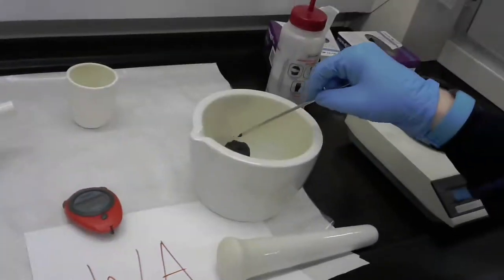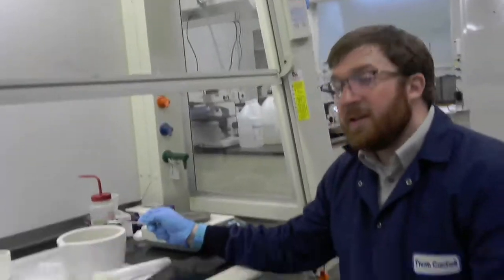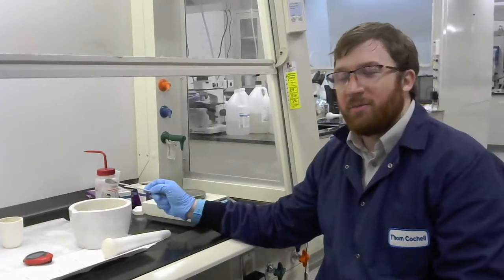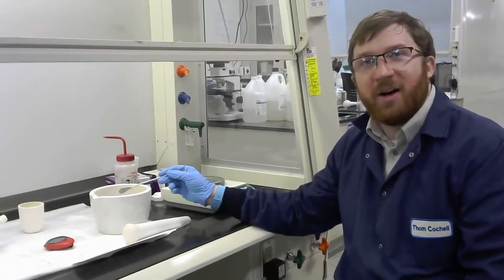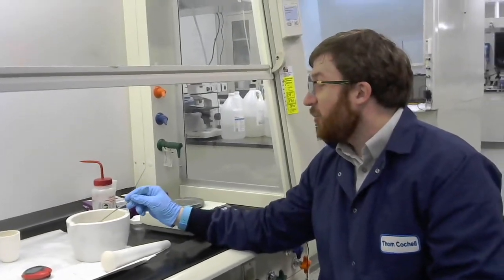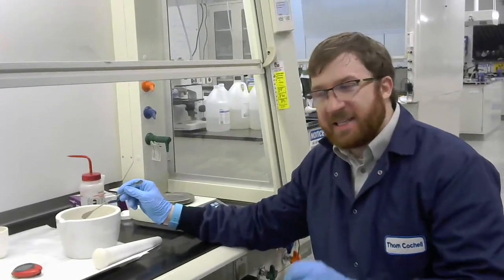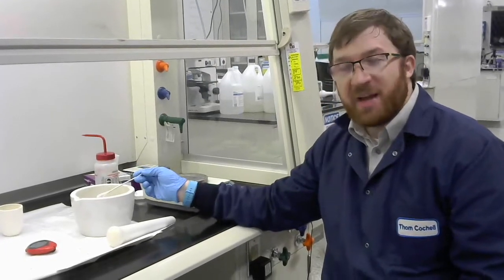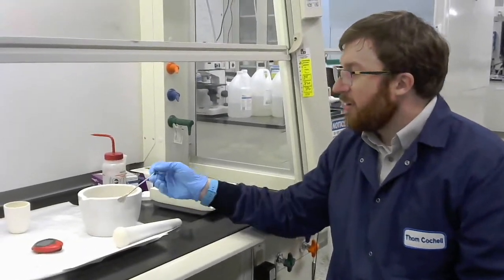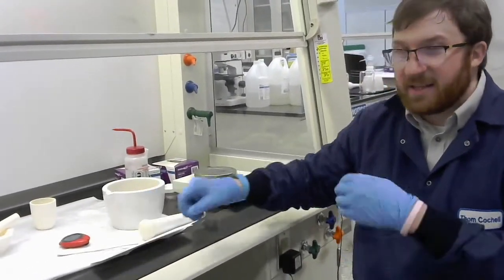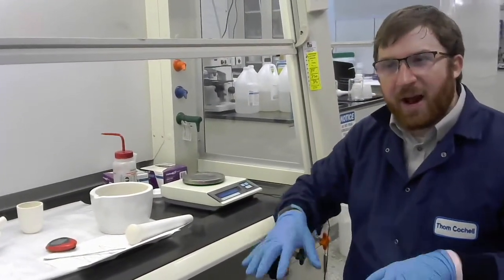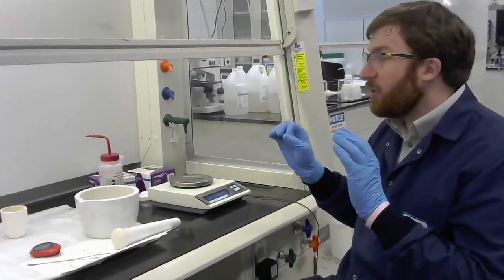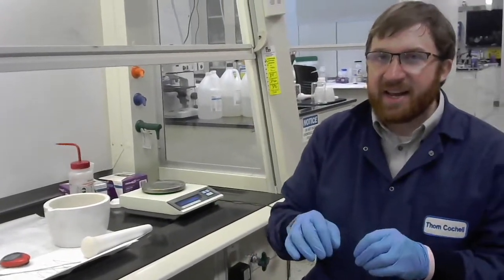So the main difference here is going to be that we have calcined, we've just calcined this powder. It's formed this big kind of blob of these powders. We've formed YBCO. That's important to note from before calcination. But basically I'm going to start on the milling process with the goal of processing this powder down to something that we can do in the dry press. So you've already watched the dry pressing video.